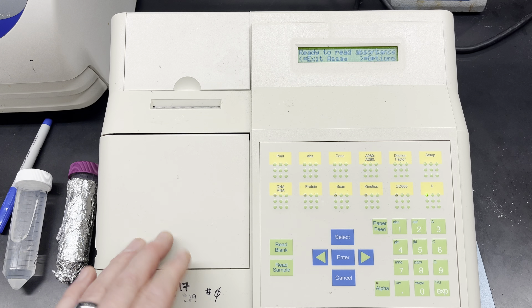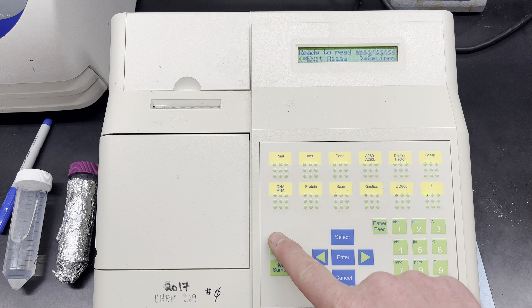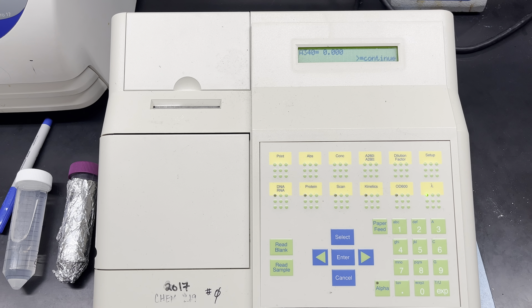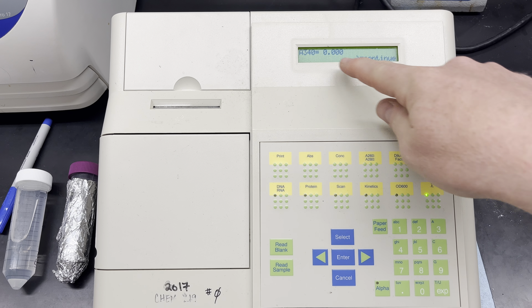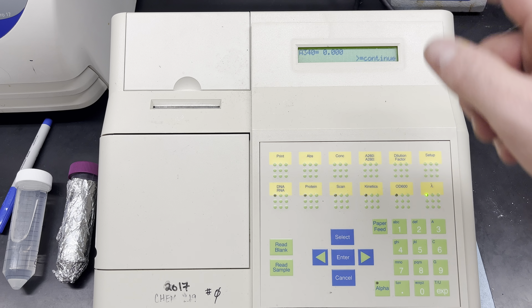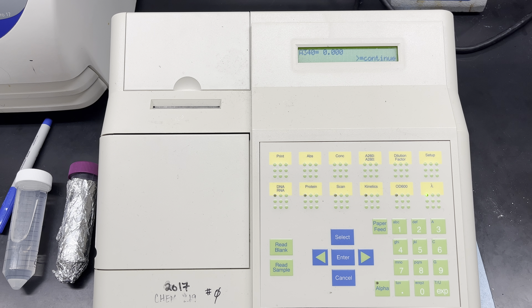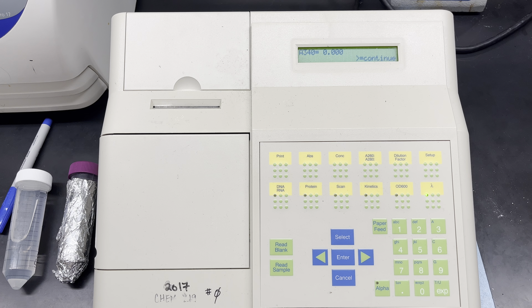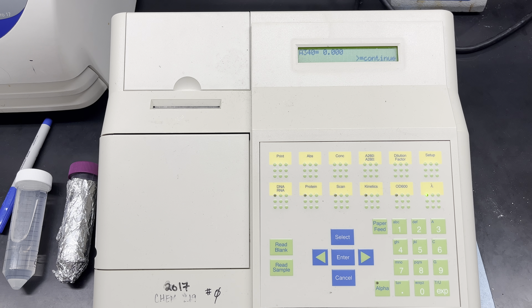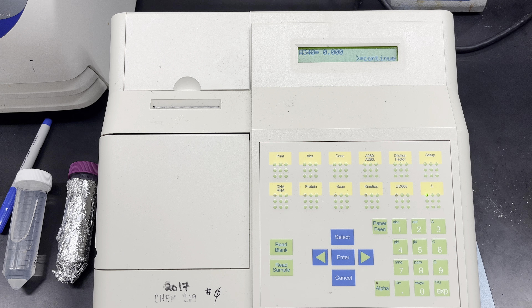I put that in and now I'm going to press 'read blank.' It gives me a 0.00 — there's nothing in there, so that's not too surprising, but that's what I want to see. I want to see that whatever is in that cuvette has been zeroed out, meaning my NAD+ solution has nothing in there that reads at 340 nanometers.